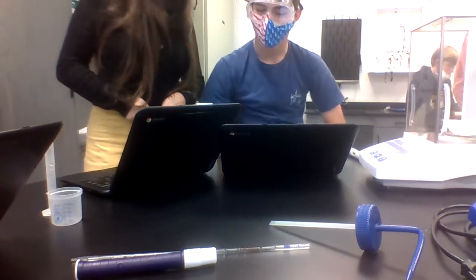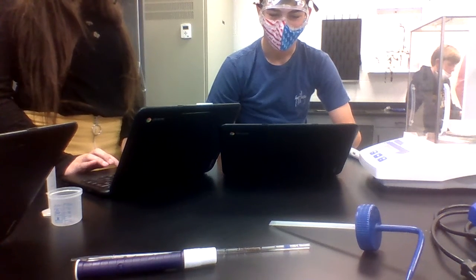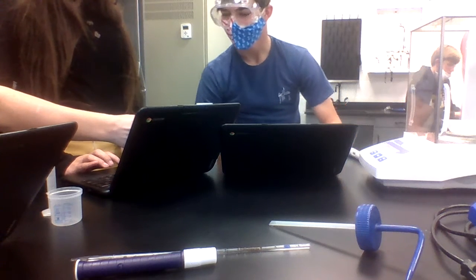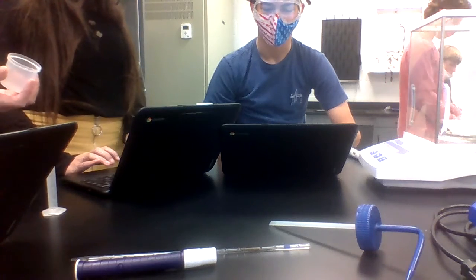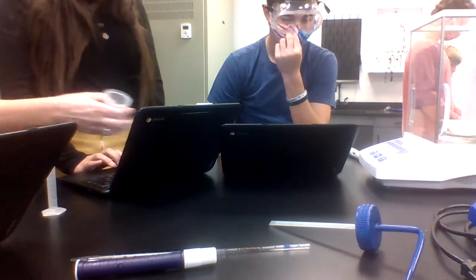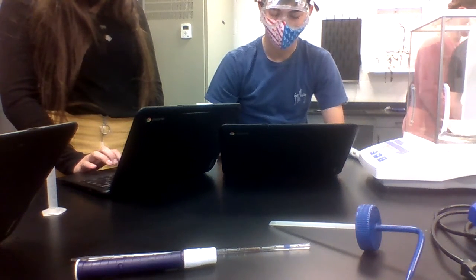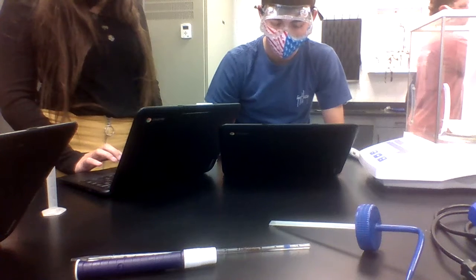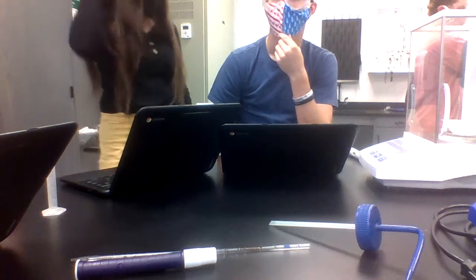Wait, what are we doing? We're supposed to be recording ours down here, and we can just copy and paste. Now, okay, up here, when you're doing the beaker, you didn't have that many decimal places. I just wanted you to make sure when you're figuring your density and doing your numbers, that this beaker has no decimal places. You just estimated it. For volume, you're using what this has, which you just estimated, so you can't say there's any decimal places in that one.